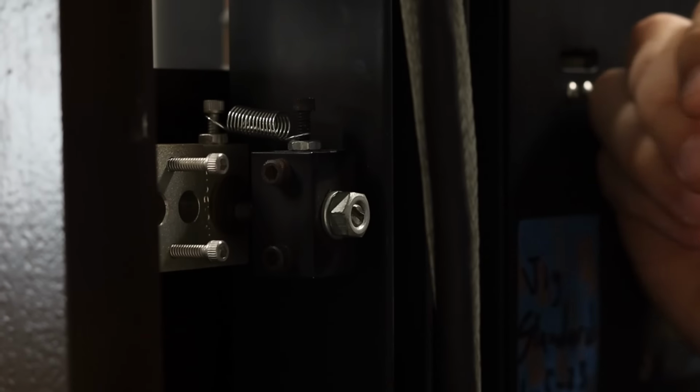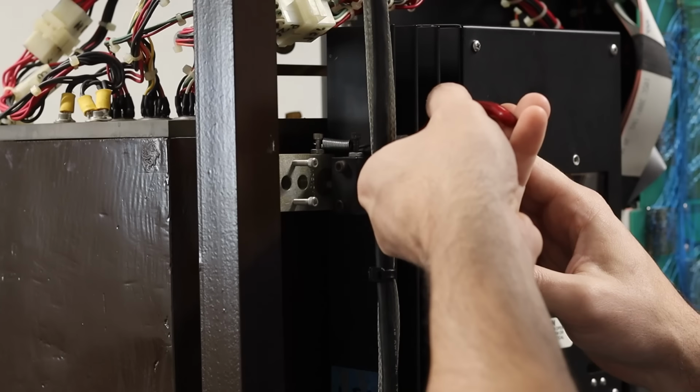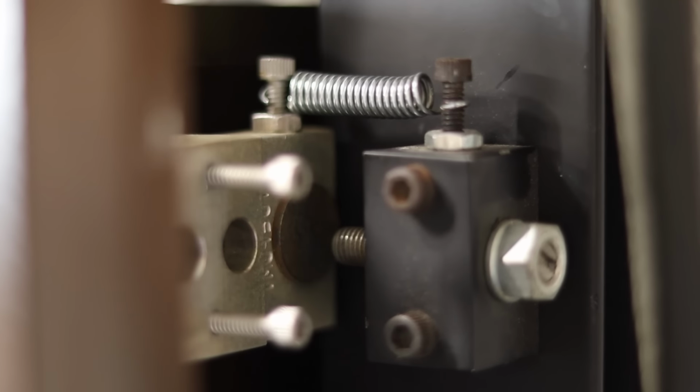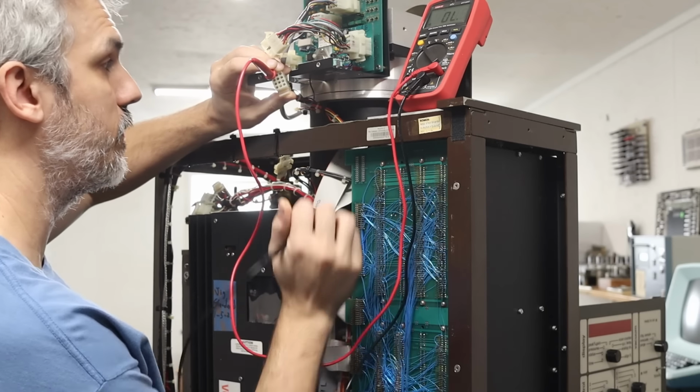The first thing I wanted to do though was replace the rubber bands that hold the laser in place with a proper spring, but this spring that I chose is way too weak. So I dug through my box of springs and found one much stronger. After popping it in, yeah, there we go, that's much better. All right, next let's move on to trying to figure out what's up with my power delivery.